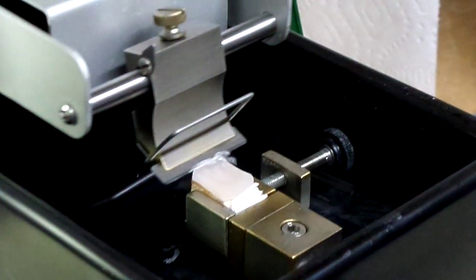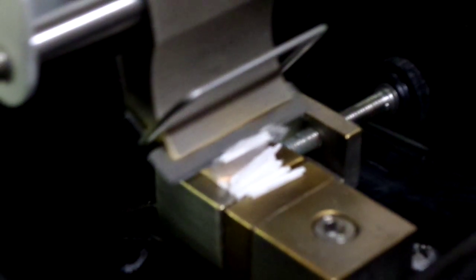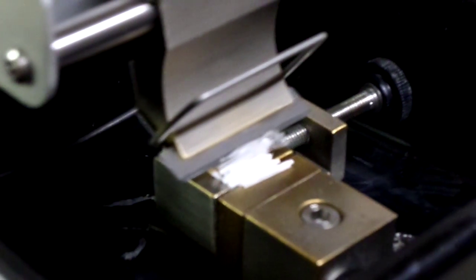As you can see, it's going much faster now. It looks like it's cutting pretty good anyway. It's not as precise so it will probably catch more on the way back.